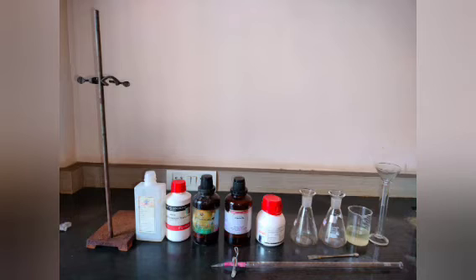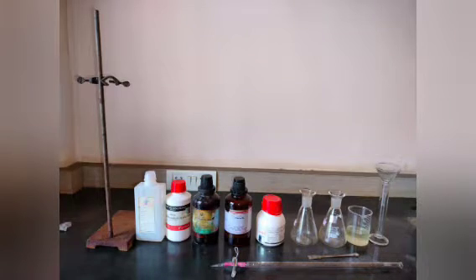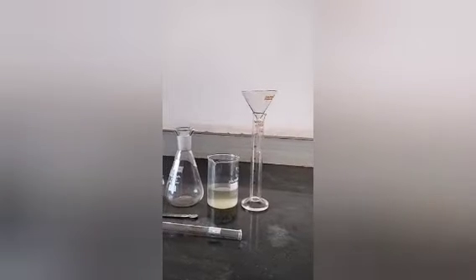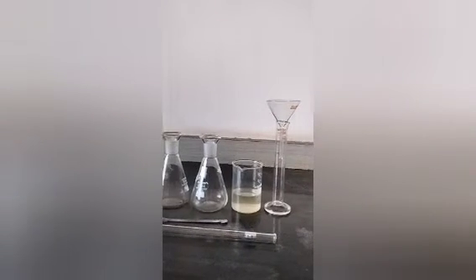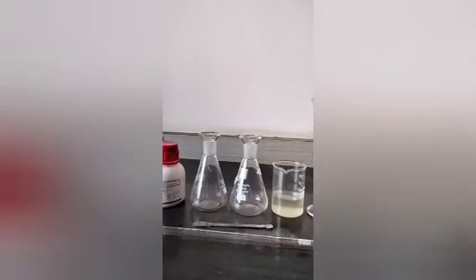These are the chemicals and apparatus required for the performance of the experiment: measuring cylinder, funnel, beaker containing potassium hydroxide solution, two conical flasks, spatula, burette, hydroxylamine hydrochloride reagent, lemon oil, cinnamon oil, methyl orange indicator, ethanol, and burette stand.